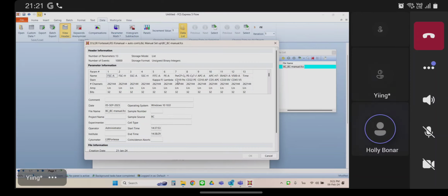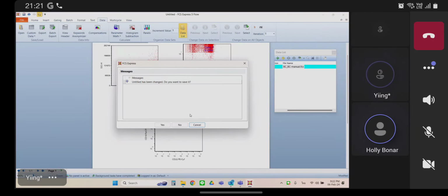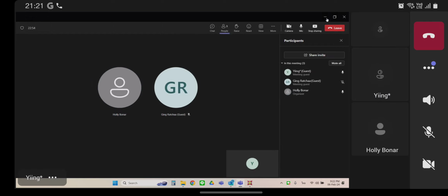And if you're not using the width parameter in your analysis, you don't have to export it. But once you decide you're not going to export it, you need to consistently not export it so that the template doesn't break. Does that make sense? Okay. Because if you build your LSR2, so let's close this. Let's go back to your layout. This is your LSR layout, like the one that you're having trouble with.